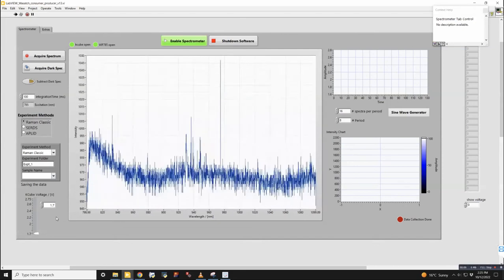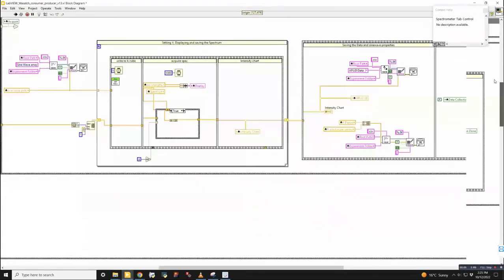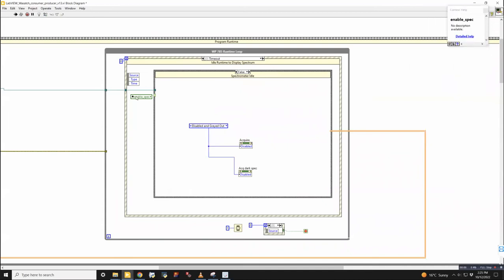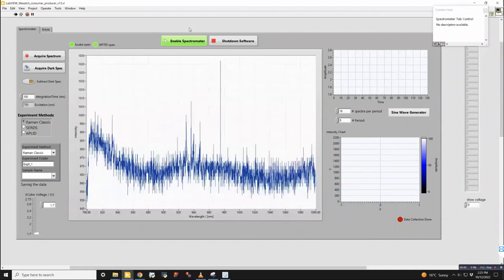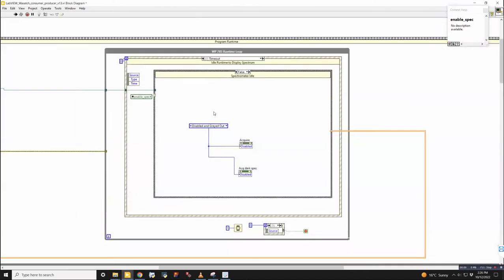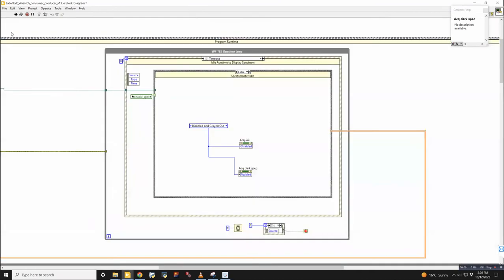And that's the basic principle for pretty much how every single button here works. So for instance, what's happening up here in this runtime loop is when it's timed out, the first thing that it checks is for this enable spec, which is this button. So by default, this is enabled. So this value is true usually. If the value is false, which is the case right here, then what's going to happen is it will disable these two buttons, the acquire spectrum and the dark spectrum button, because you can't do anything. The spectrometer is not enabled, so you're not going to try and acquire anything.